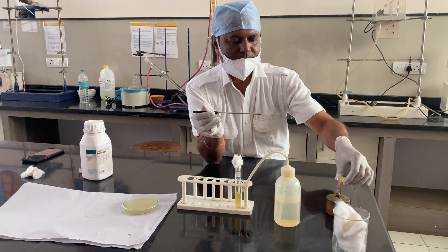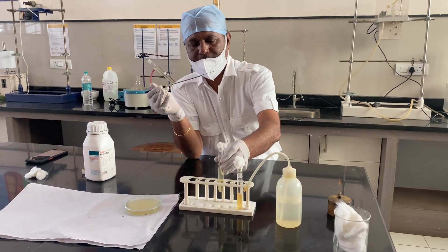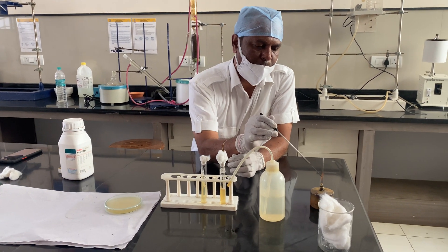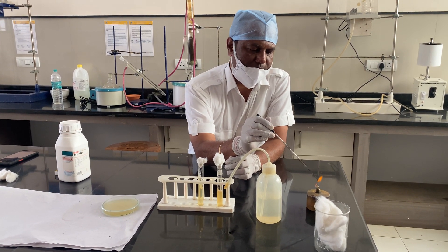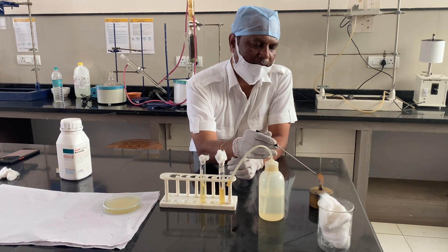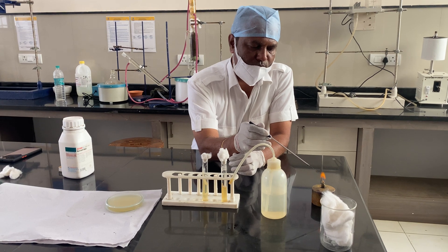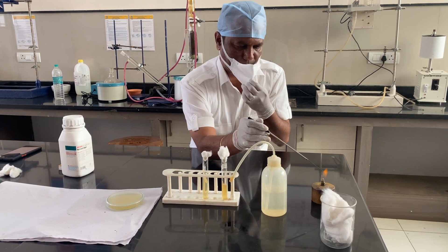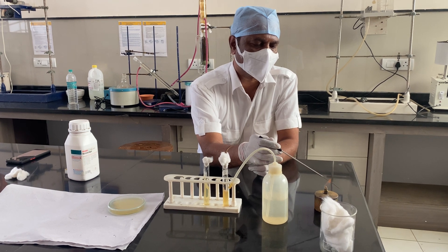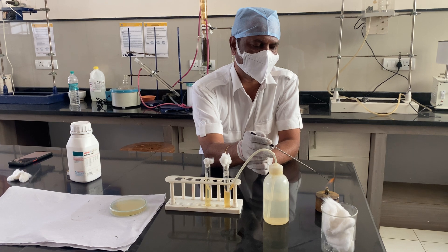After the transfer, pass the loop through the flame again. As I repeatedly emphasize, before and after use this loop must be sterilized, because we do not know what sample or type of microorganism the next person will be working with. So it is very necessary to sterilize before and after every use.